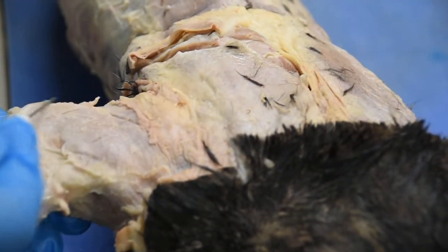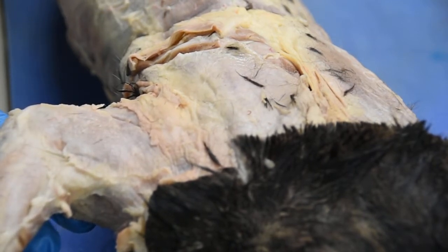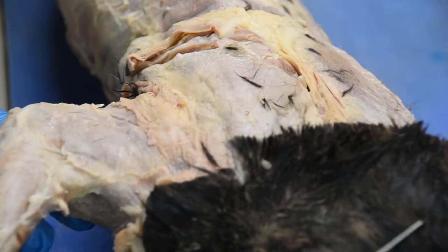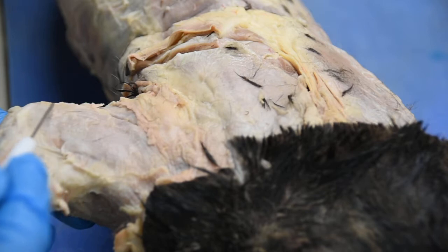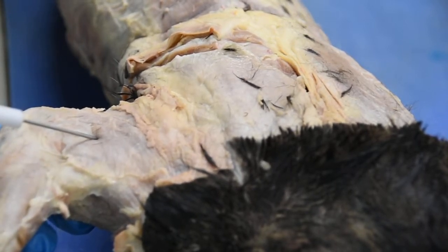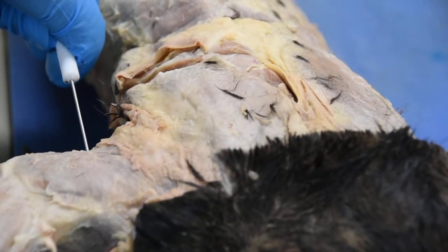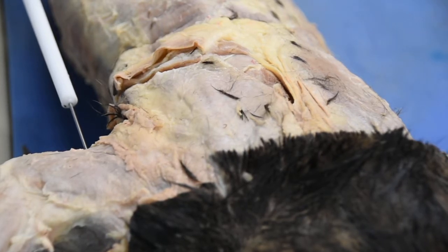Following up, in looking at the arm, you have the muscles of the arm. Right here on this part, you see two of the three heads of your triceps brachii. The one that you can see right here, this is the back of your cat's arm. This muscle right here would be the triceps brachii lateral head. The one you will see right underneath it, where I put the pin, that's your triceps brachii long head.